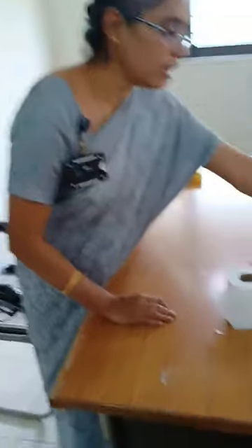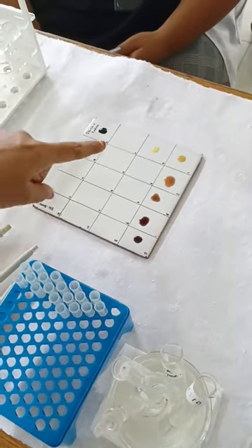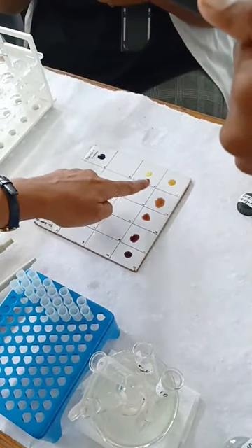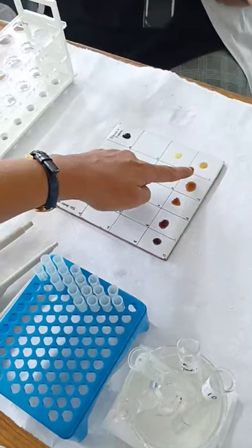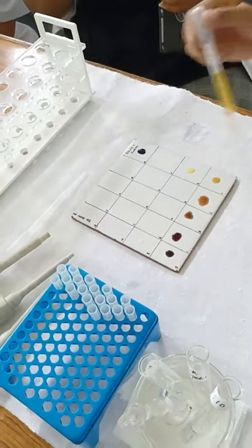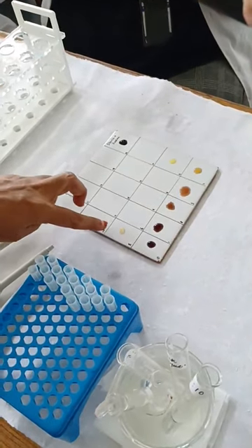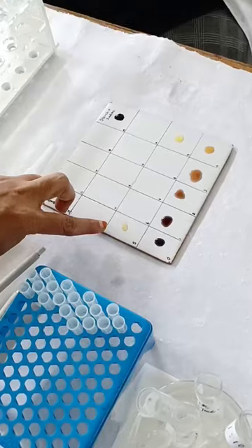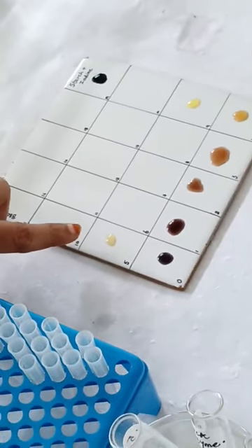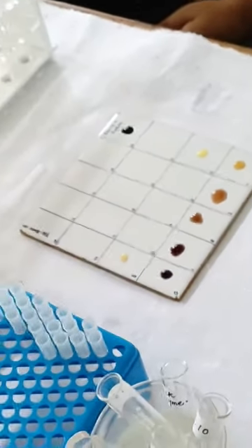To make it easier to see the end point, we take a drop of iodine and place it at one point on the tile to compare the color. The iodine drop serves as a reference — when the reaction mixture color matches the iodine color, we have reached the achromic point. At the 5th minute there is a good change in color; comparing the 4th and 5th minute there is a drastic difference. We wait one more minute and check whether we have reached the achromic point.